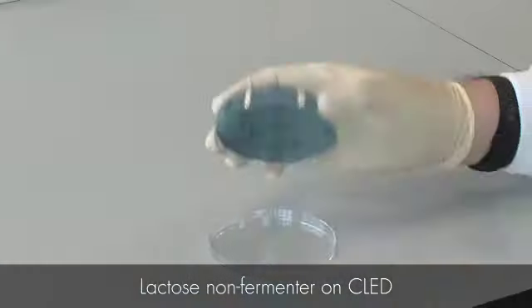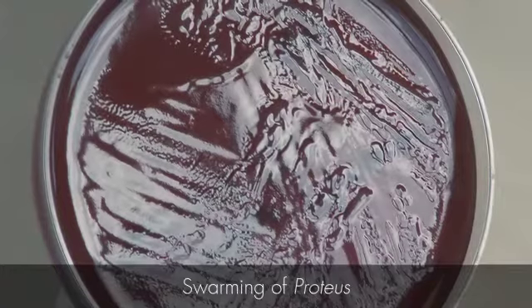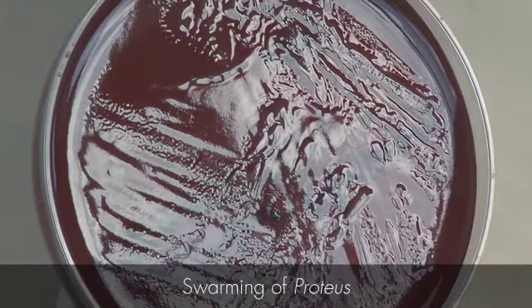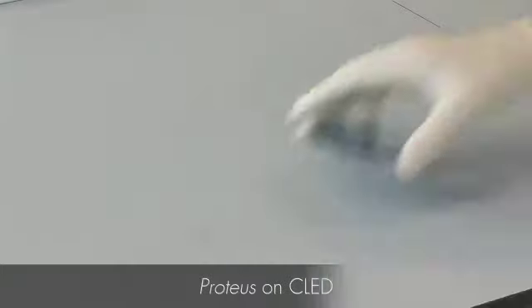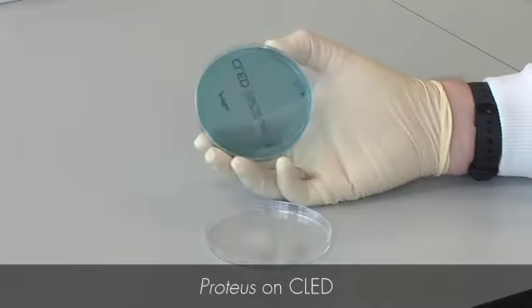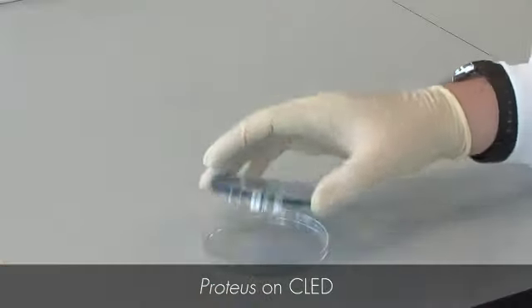Another feature of CLED is that it inhibits the swarming growth of a pathogen of the urinary tract called Proteus. This is Proteus growing on a blood agar plate, and as you can see, it has covered the whole plate. When this happens, it's difficult to see if there are any other species of bacteria present. However, when we look at Proteus growing on CLED, it produces discrete colonies. So inhibiting the swarming of Proteus is another useful feature of CLED.